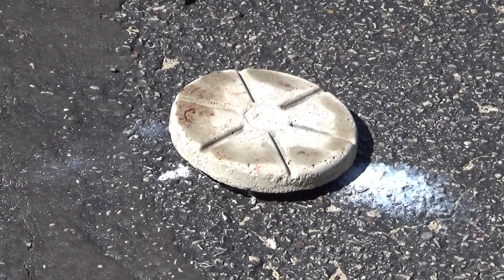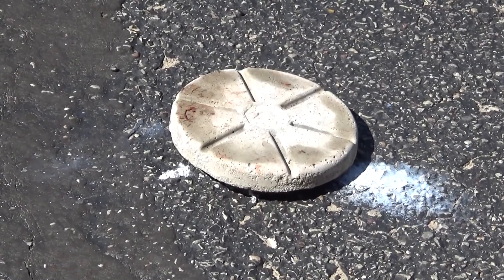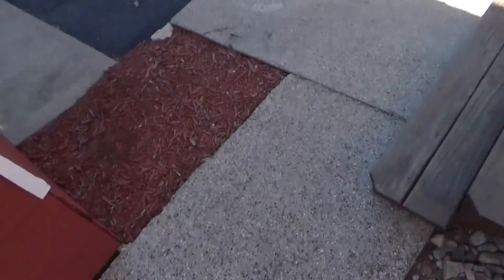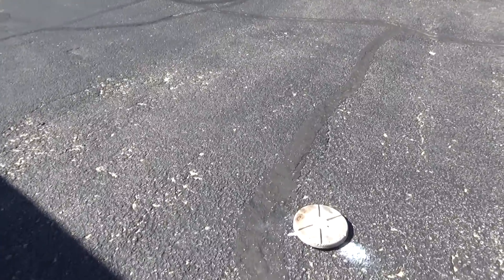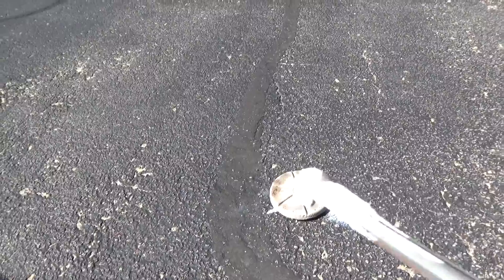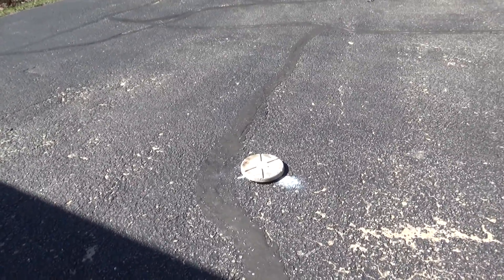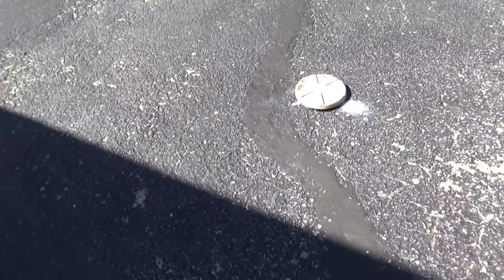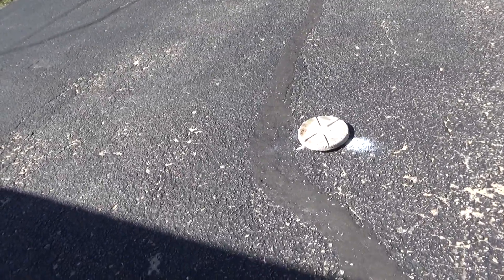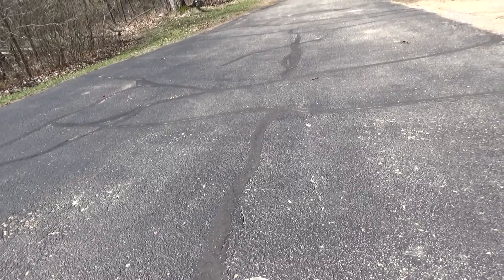Well, I think it destroyed my can. That poor can just got destroyed. I'm backing away from this. I guess I got some good news and bad news. The good news is my homemade fuses work perfectly for this, so if you're doing this yourself I recommend watching that video — works just fine. Bad news is, of course, it destroyed my can. There was a big fireball that came out of the bottom. That must be sodium reacting with the air — I can hear a little bit of sizzling. Yeah, that was hydrogen igniting that caused that big fireball. But right after that, it completely destroyed the can, so I'm going to have to find a new one. I was hopeful, but at the end of the day there's no way that can would have worked. Use steel and not aluminum.